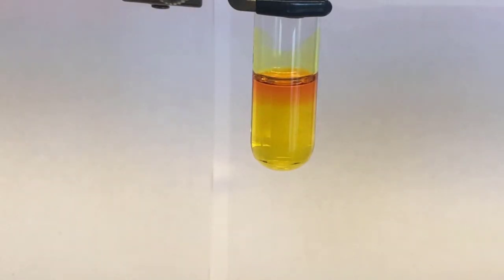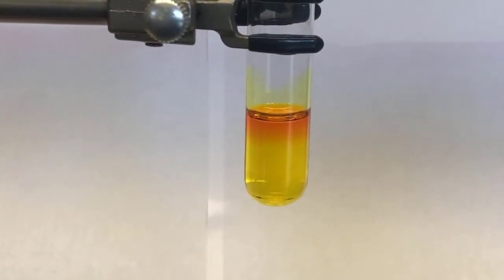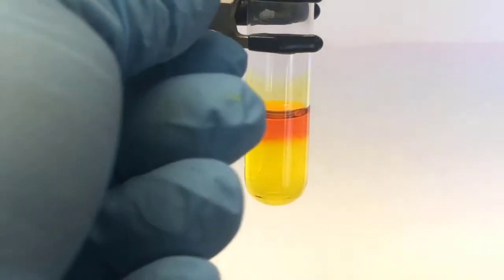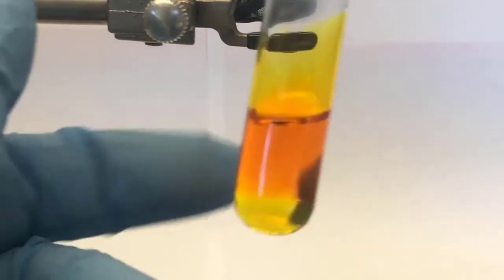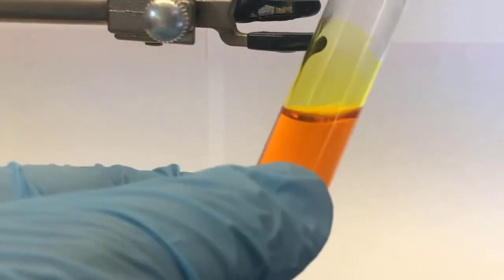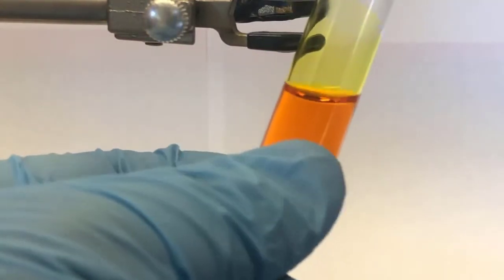Okay. And hopefully you can see that color change. Then I'll add another 1. Actually, these are like little half drops. There, I got it in there. A little bubble in the pipette tip. And then we'll mix it up. Take it out. You tap it on the side, it'll vortex the solution. So there's the color change.